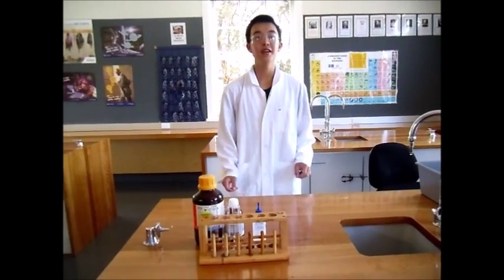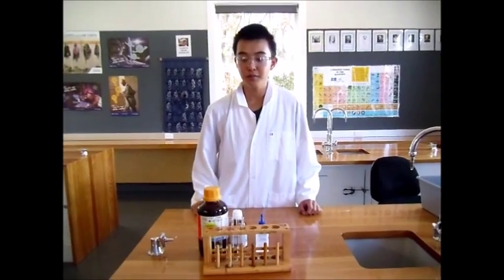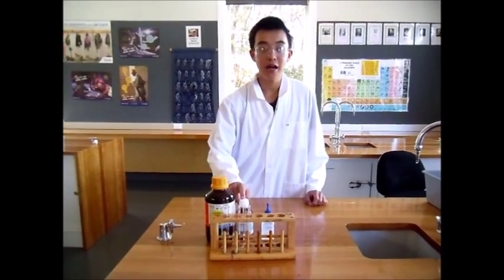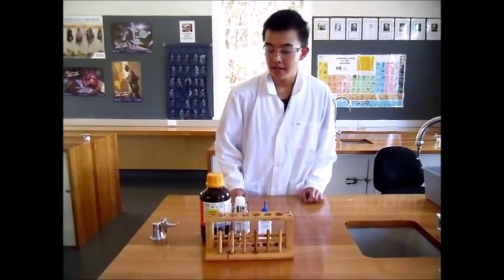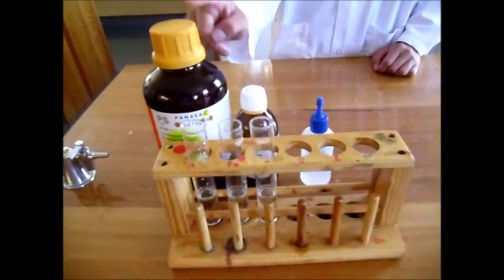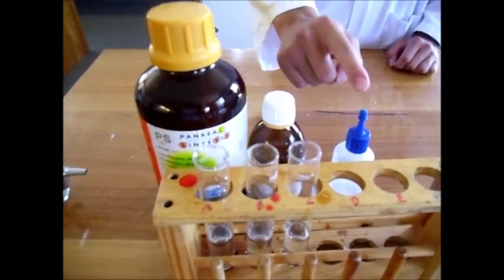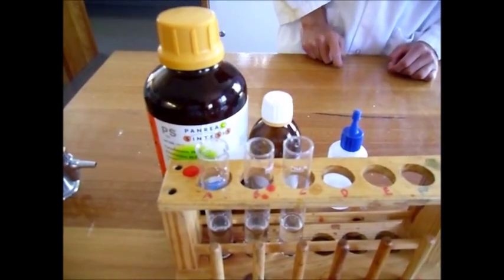Hello, today we will be investigating the solubilities of alkanes, alkenes and alcohols. The alkane we have is cyclohexane, the alkene is cyclohexene, and the alcohol is isopropyl alcohol.